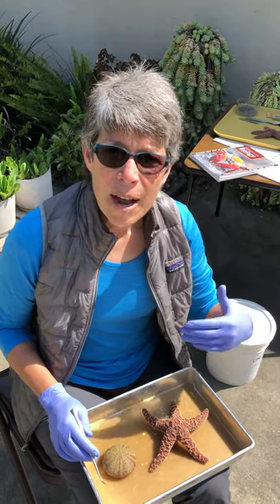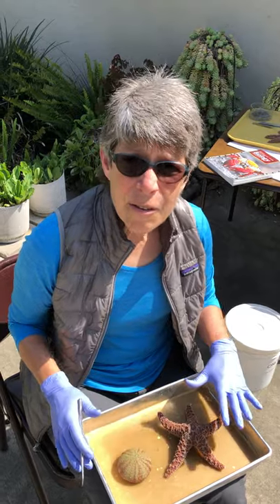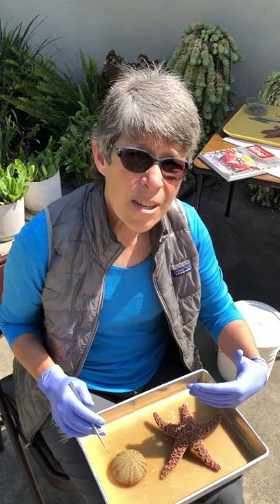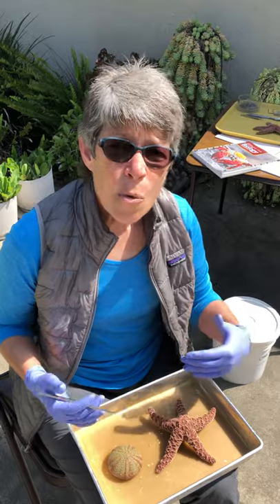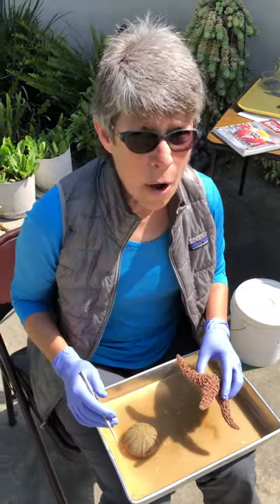This is the first in a small series on Echinoderms. These videos are intended to simply build upon some of the videos already available to you in a presentation. Those videos are awesome — the content and explanations are awesome. The only deficiency is that sometimes they didn't have the capability to zoom in closely enough to really see the things they were pointing at. So since you're not going to have critters of your own to look at, we're going to do that for you. Man, look at those other videos because they are amazing.